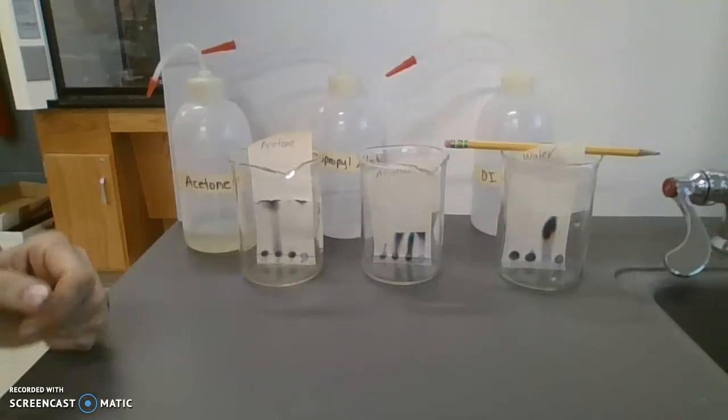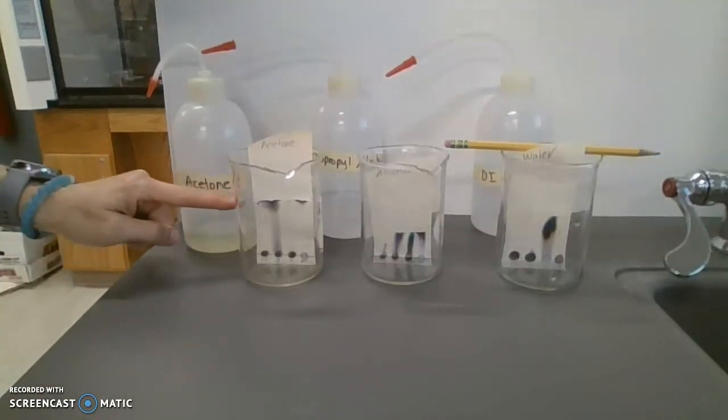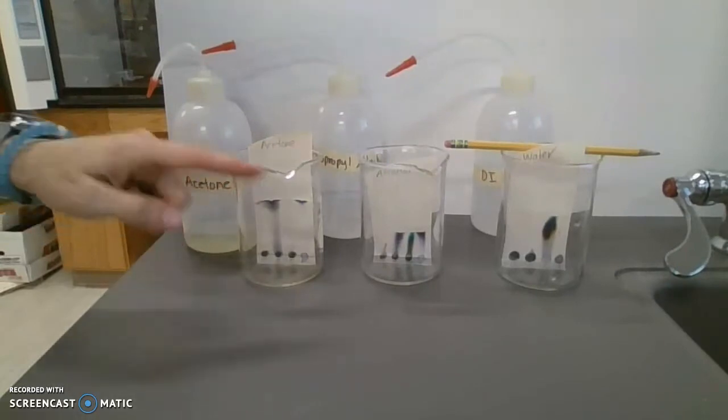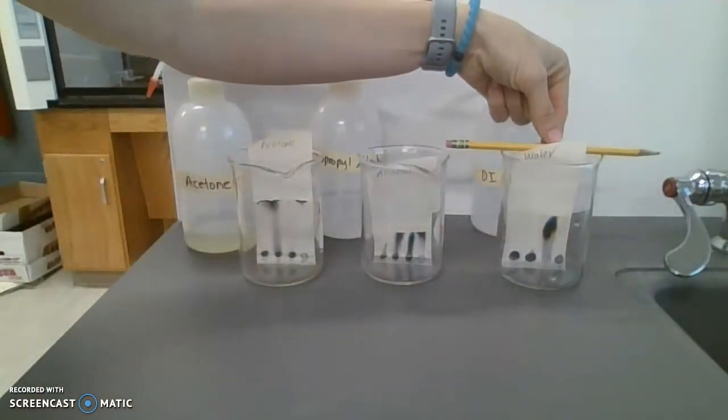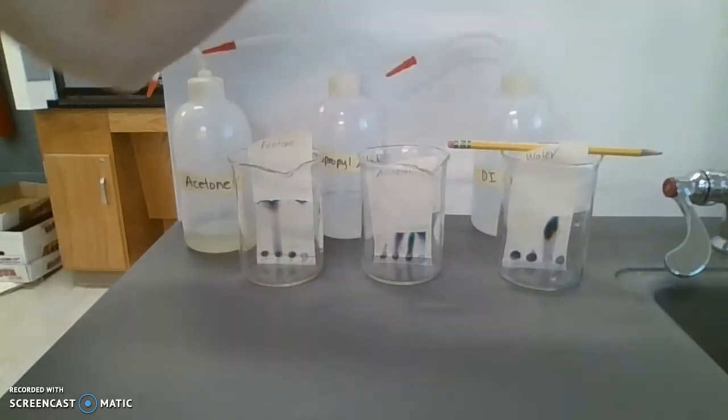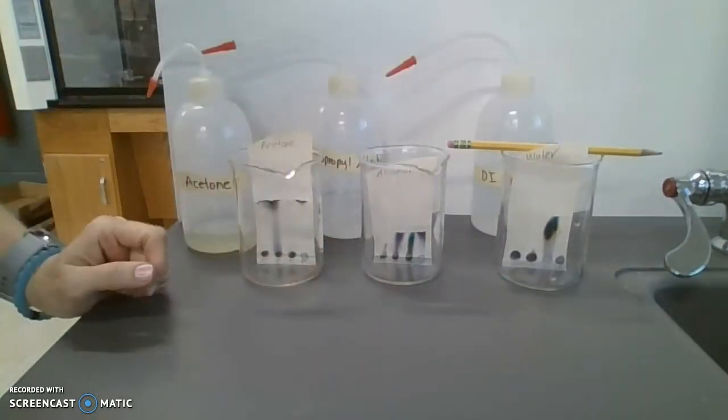All right, after several minutes, you will notice that the solvent line comes all the way up our papers. Okay, the water I needed to put a pencil across so that it didn't sink down into the water.